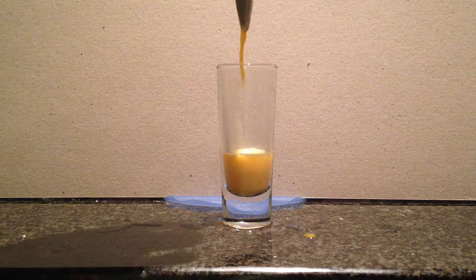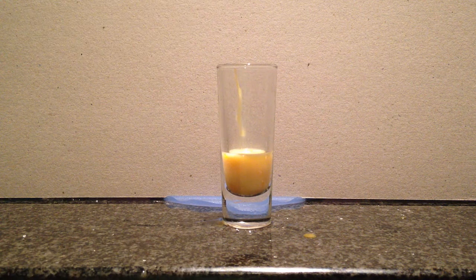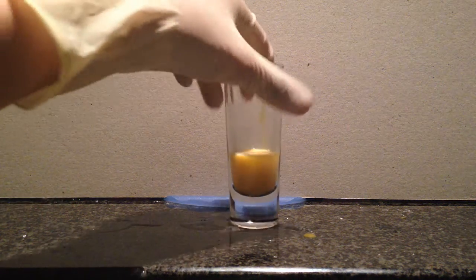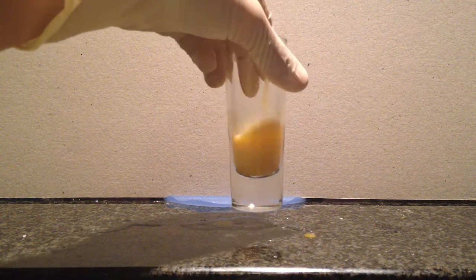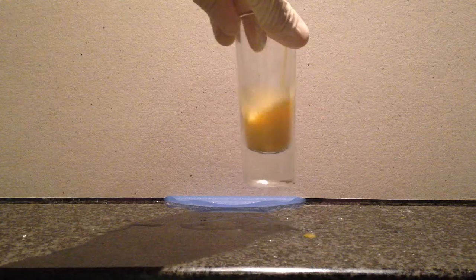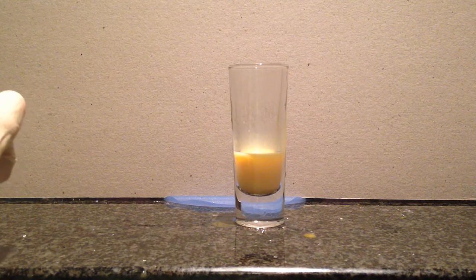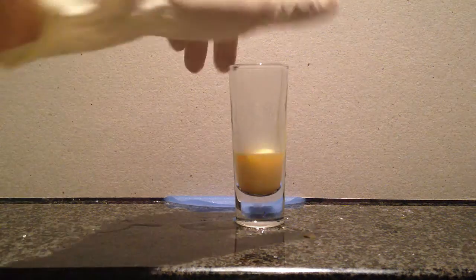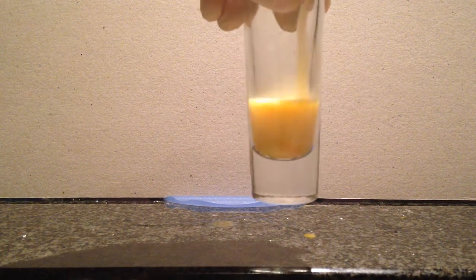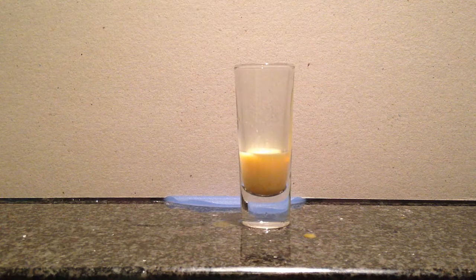Okay, we're just going to add a bit more for the random part of it. Spin it around a bit. The cheddar cheese did have some bubbles. Baked beans had very little to none. And the egg white and the egg yolk, I think it's the same thing, both have changed colors to a lighter state. So that could mean there are bubbles, but I'm not too sure on that.